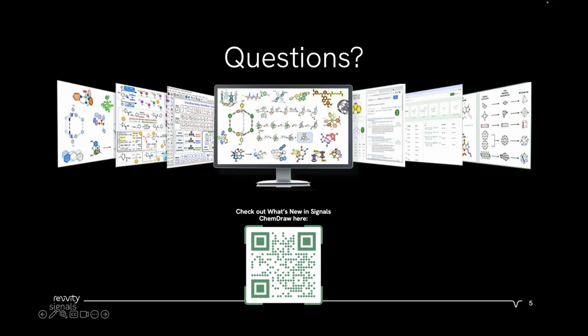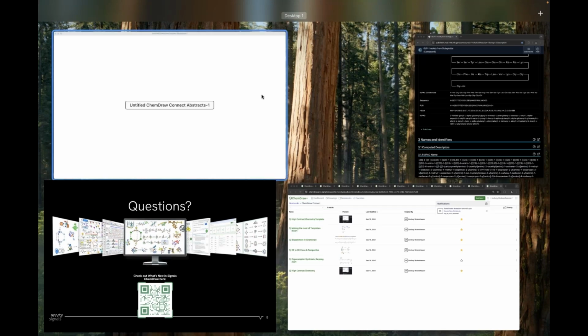Awesome. Okay, we have a few more questions. I think I answered it, but I'll be a little bit more clear. How can you access ChemDraw Plus? ChemDraw Plus is available with a Signals ChemDraw license, and that was released and launched alongside version 23 of ChemDraw. So if you have version 23 or higher of ChemDraw and you have a Signals ChemDraw subscription, you can access ChemDraw Plus. As for the accessibility of it, let me go back into ChemDraw Desktop.